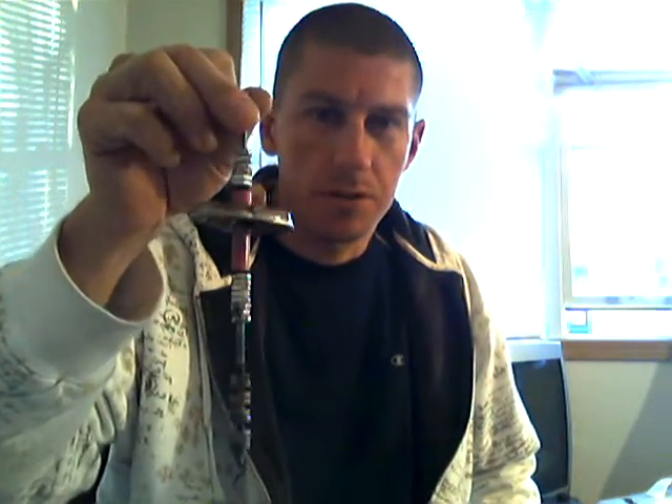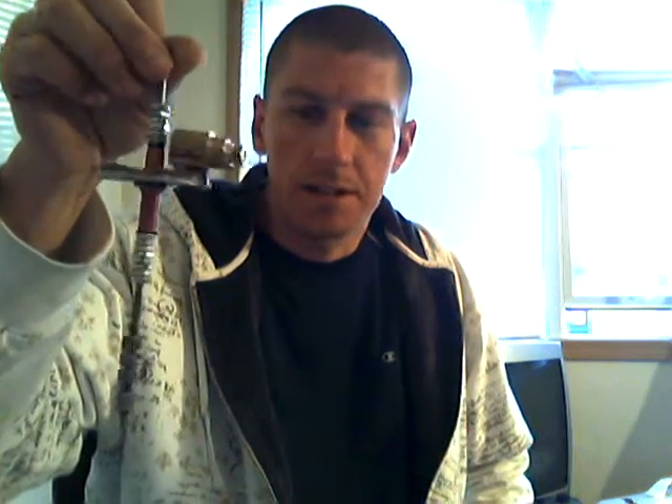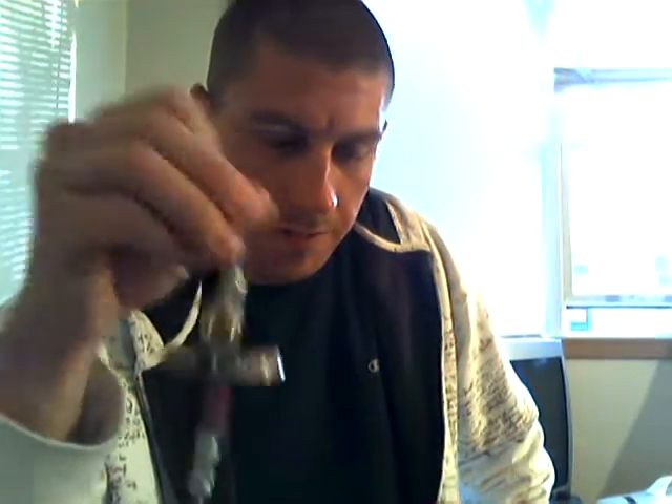Unfortunately this did not work either. It was a very bad idea from the get-go. I would not have been able to remove this top from the crucible because the molten sodium hydroxide gets as hard as concrete. Also bear in mind that this electrolysis process puts off two gases — not just one like I thought — it appears to be putting off oxygen and hydrogen, which generates a very explosive mixture, so be on the lookout for that.